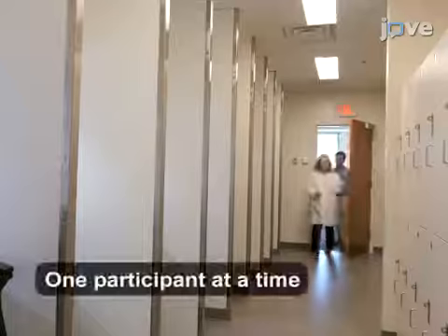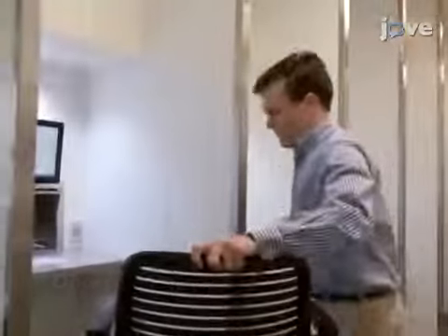Next, escort the participant to the sensory booth and have them sit straight up against the back of the chair. Instruct the participant about the experimental process and standard operating procedures.